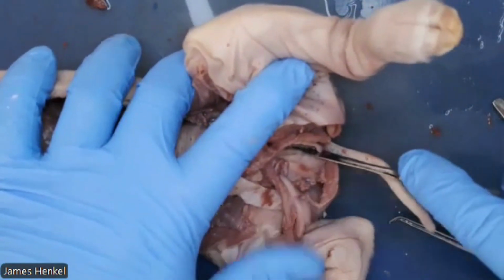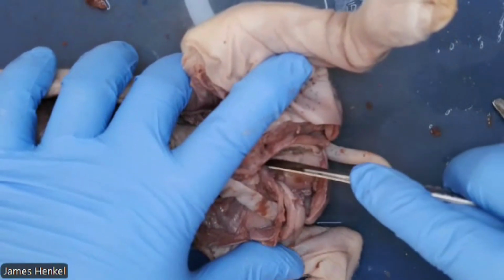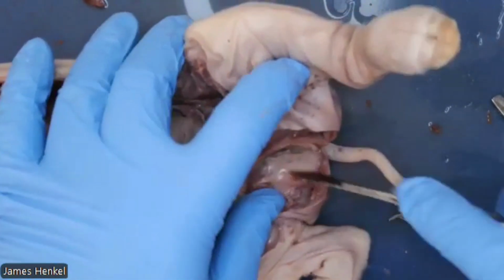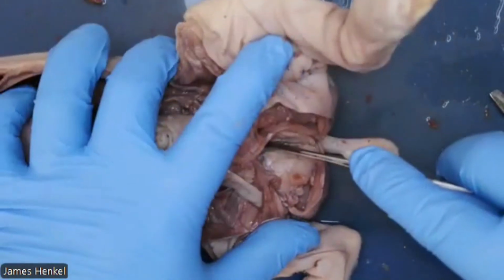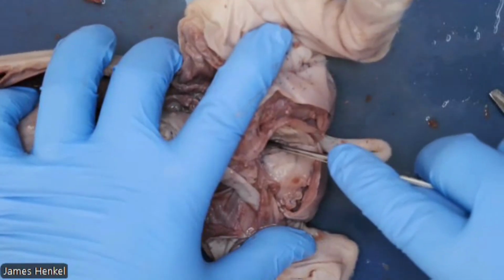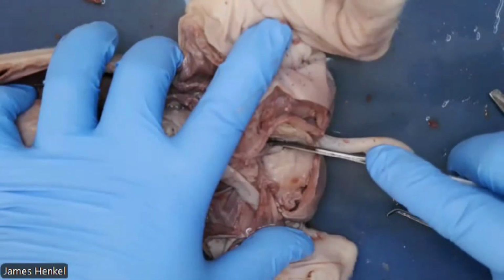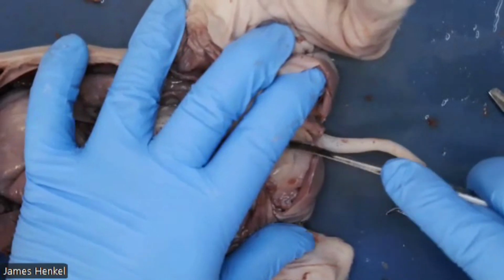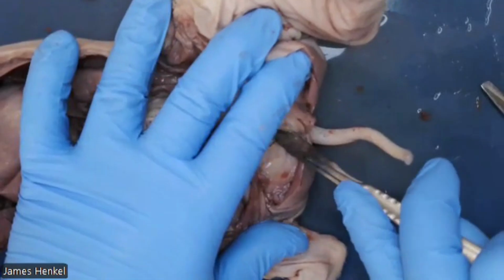Okay, we're going to cut through the pelvic bone just like we did for the females in a direct line to the tail without cutting the penis. So we'll cut a rectangle of this so we can expose that entire connection there, just like the female pig. Cutting along this, you can cut into the bone. It's better not to push too hard. You can just draw it across the surface with a sharp scalpel and make as effective of a cut.